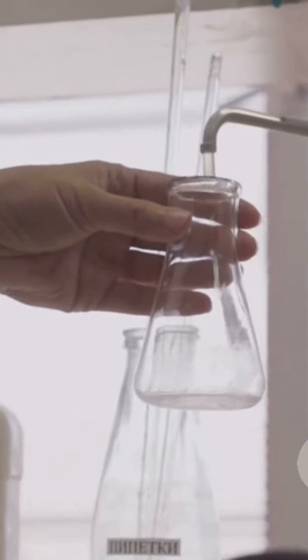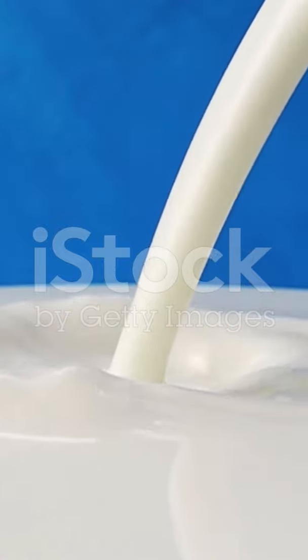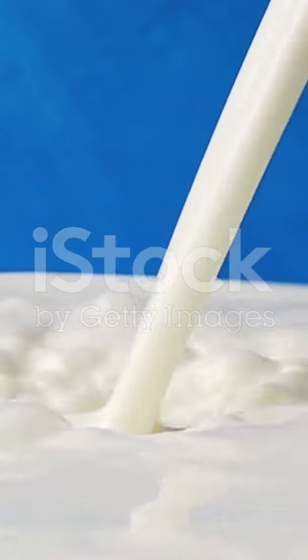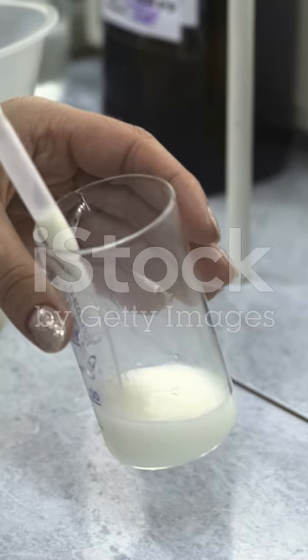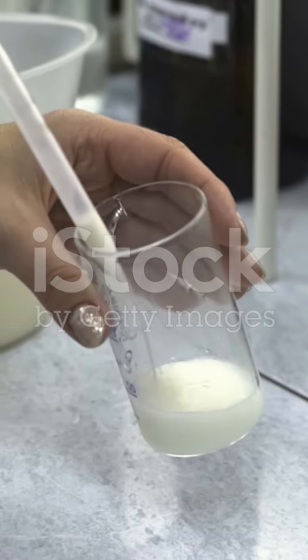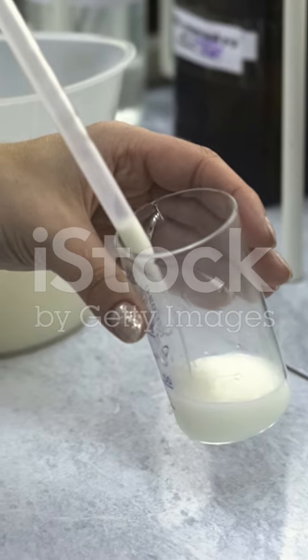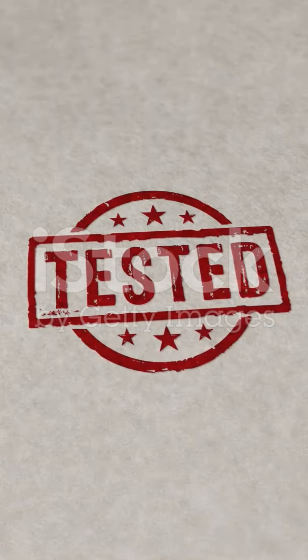Milk coagulation studies can be used to determine quality and purity of milk. The ability of milk to coagulate properly is a direct indicator of its quality. Milk adulterated with water, antibiotics, or neutralizing agents will not coagulate properly or at all. Milk from cows with mastitis, that is, udder infection, has a high somatic cell count, which impairs rennet coagulation, leading to a soft, poor-quality curd. This is a key test in the dairy industry.